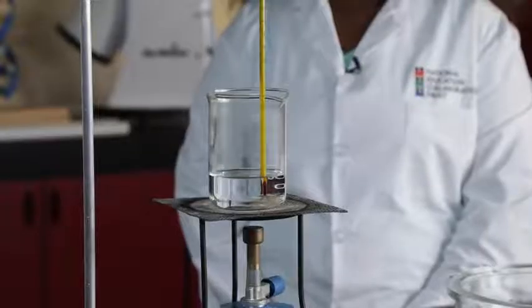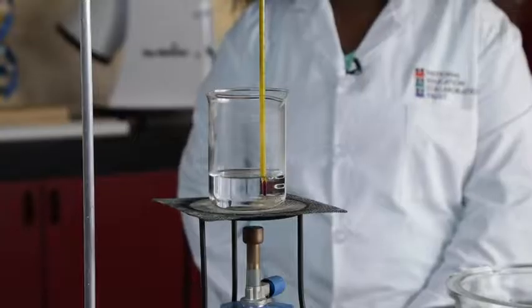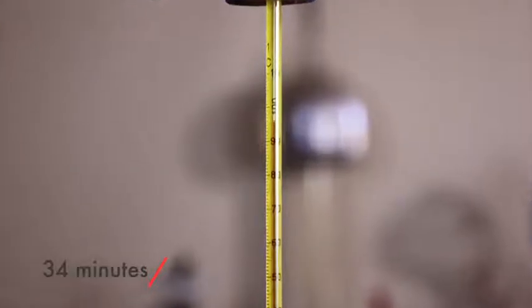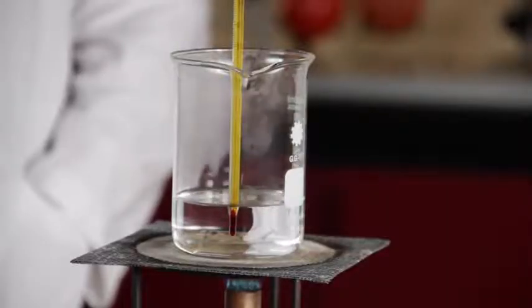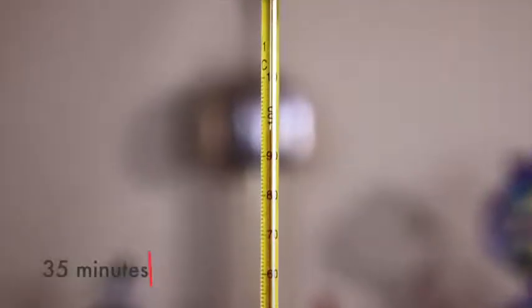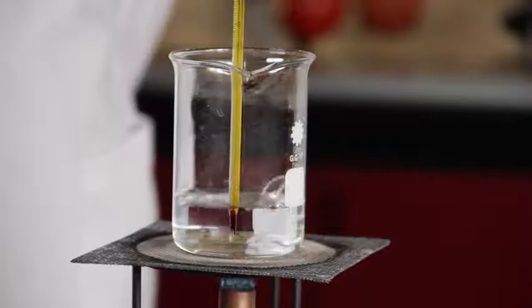This is what the beaker looked like at 33 minutes. This is a thermometer reading at 34 minutes. Write it down yourself. This is what the beaker looked like at 34 minutes. This is a thermometer reading at 35 minutes. Write it down yourself. This is what the beaker looked like at 35 minutes.